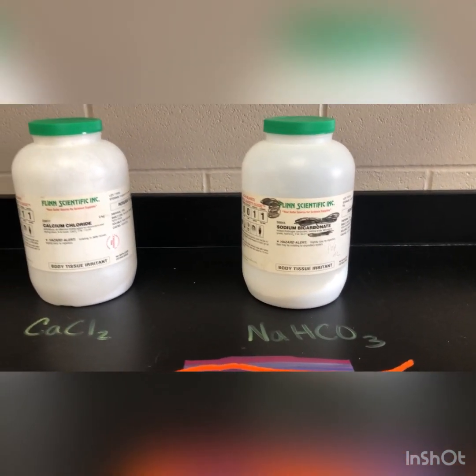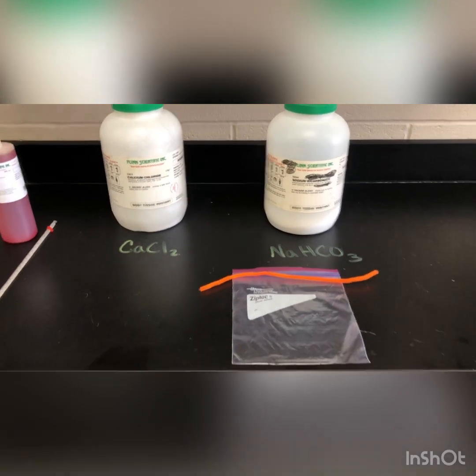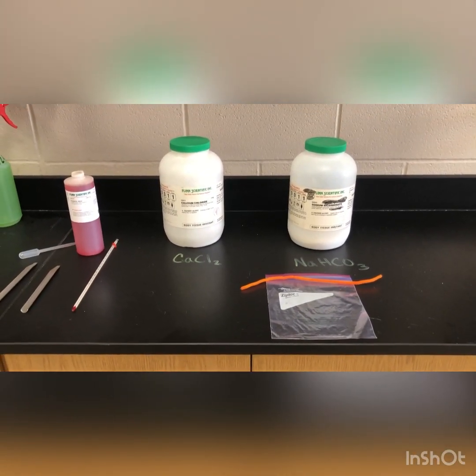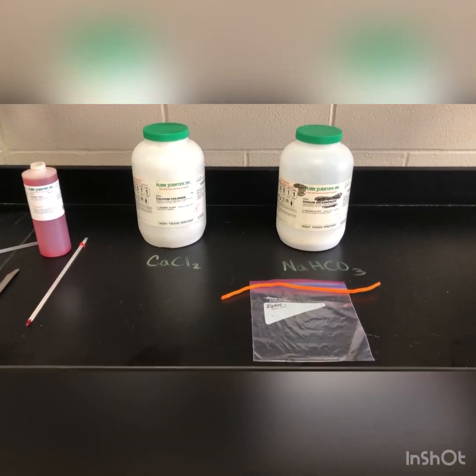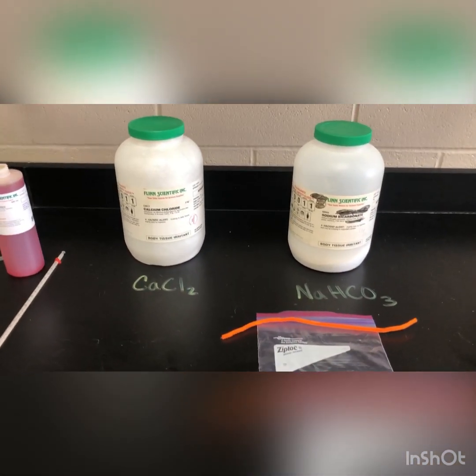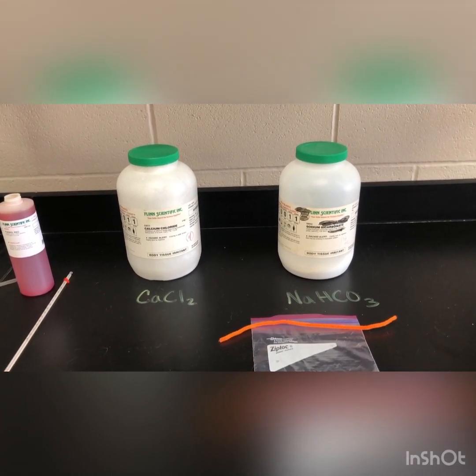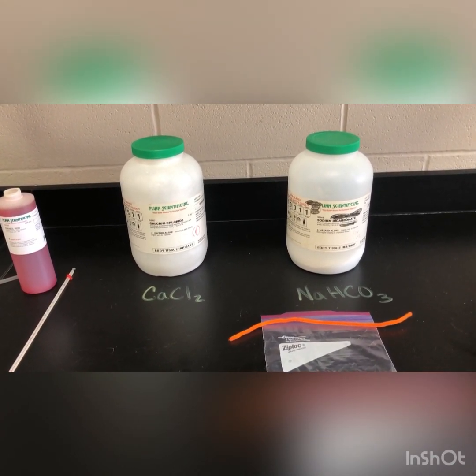Safety precautions that must be taken anytime you're in the lab: goggles and aprons must be worn, wash your hands at the end of the lab. The disposal for this experiment will be very simple because it becomes neutralized at the end — it will be safe to dispose of it in the trash.